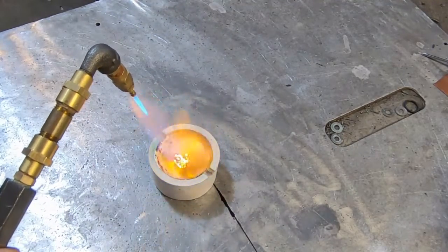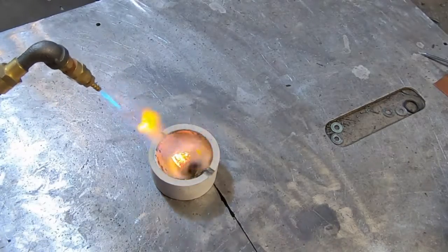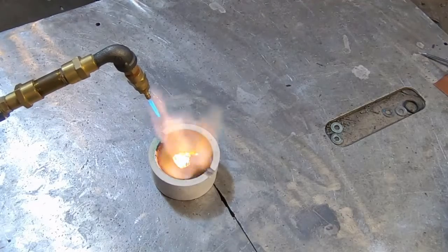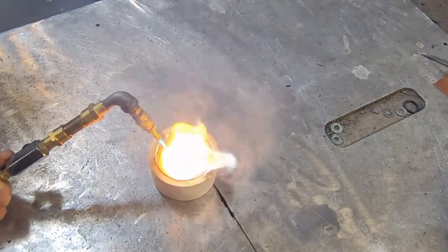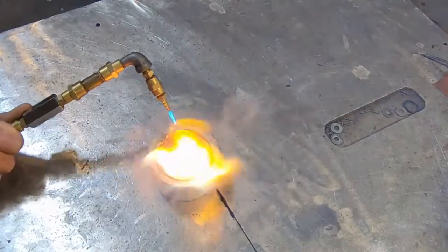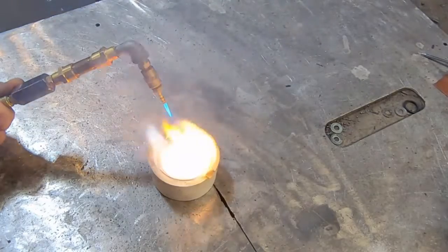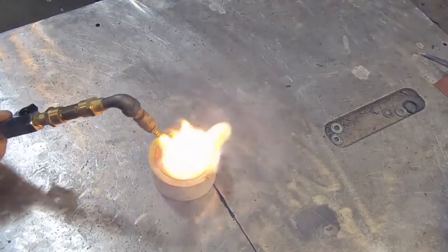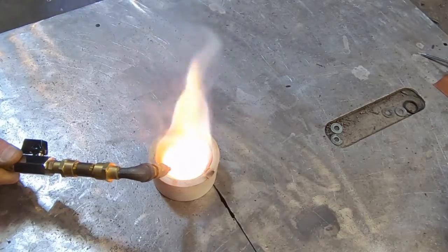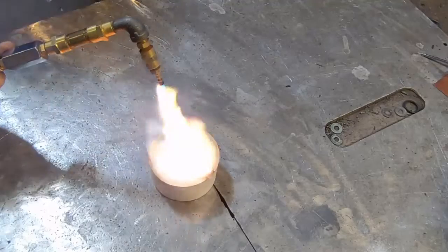What's going on, fellas? This video is about precious metal recovery, and we are using electrolysis to generate this anode sludge that I have sitting in this small crucible. I'm attempting to do a small fire assay using a 10,000 watt oxyhydrogen torch infused with some propane gas to provide a reducing flame. I just wanted to see how hard it is to melt this stuff — come to find out, it's very stubborn, and once it gets glowing quite hot, it puts off a lot of gases.